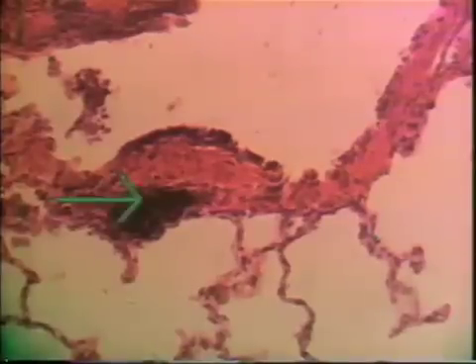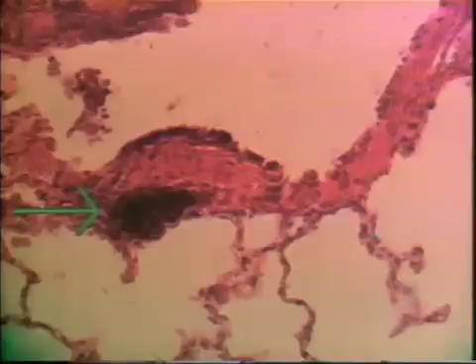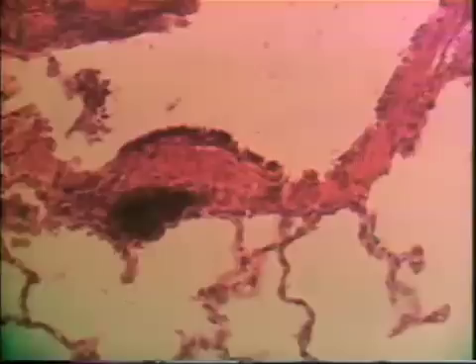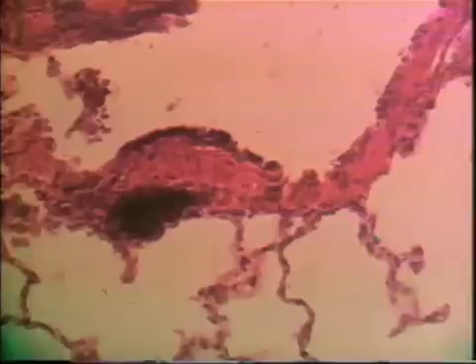Also for your knowledge, here are some macrophages down here, full of dust and phagocytized material. Now this epithelium will go from columnar to cuboidal, and when it reaches the cuboidal form we're going to have the start of the respiratory system itself. That's called a respiratory bronchiole — the first segment — and that will be the next section.